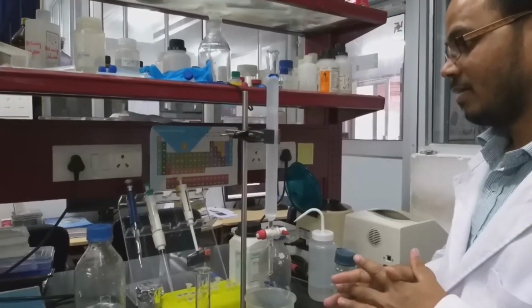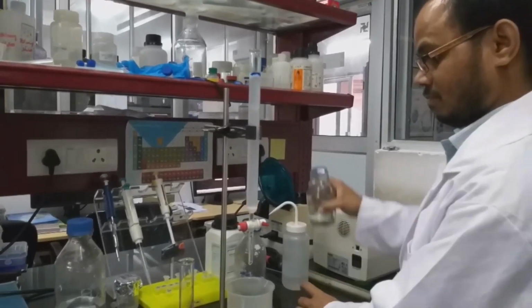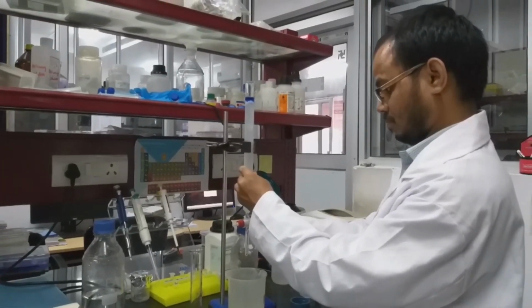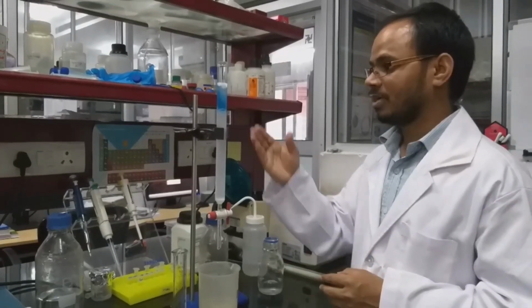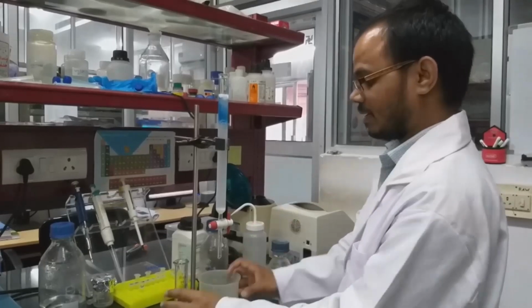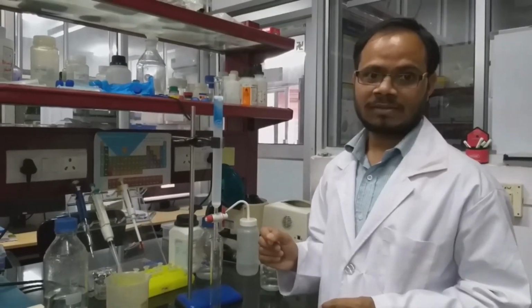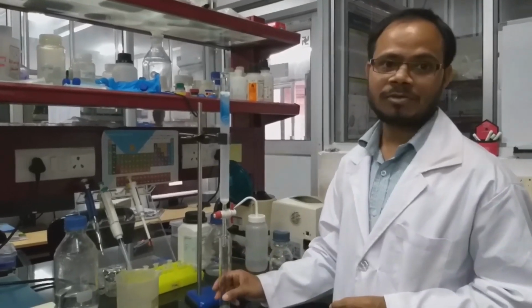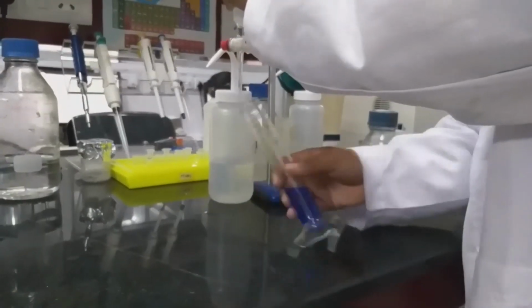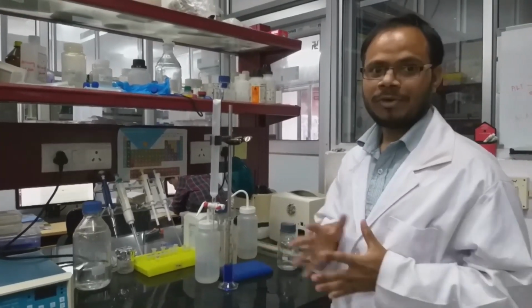So now we have loaded the blue dextran. We will add the buffer, then we will elute. As we can see, the blue dextran is passing down. We have to replenish buffer continuously, and we start collecting the eluted volume. After complete elution of the blue dextran, we measure the volume, and that volume gives us the void volume. Now the blue dextran has completely eluted. It is around 18 to 19 ml. So now we got the void volume.